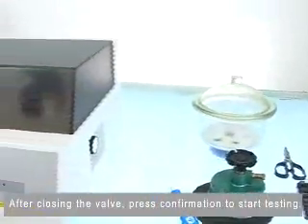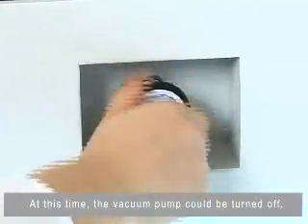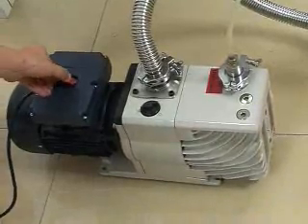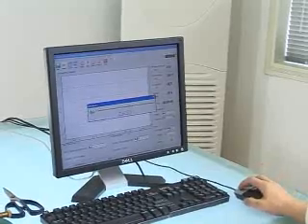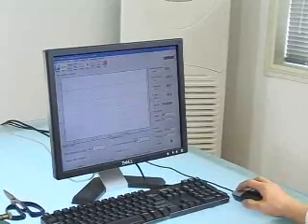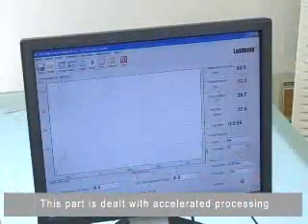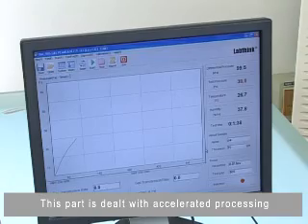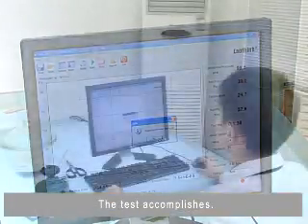After closing the valve, press confirmation to start testing. At this point, the vacuum pump can be turned off. Wait for the test to complete.